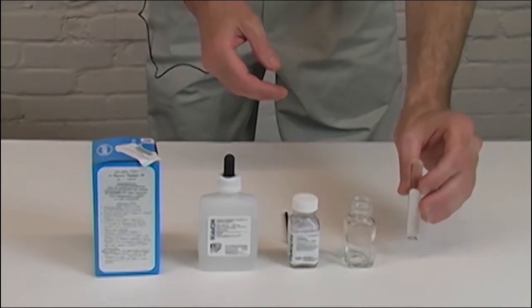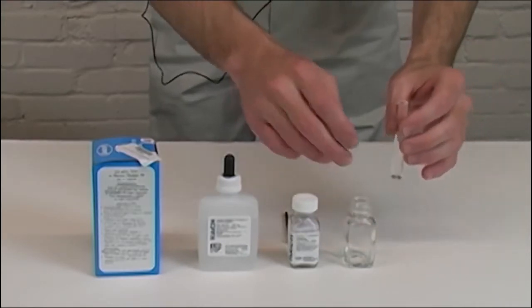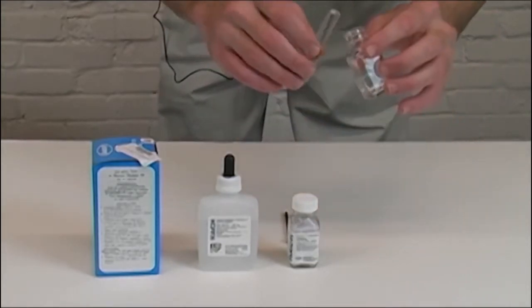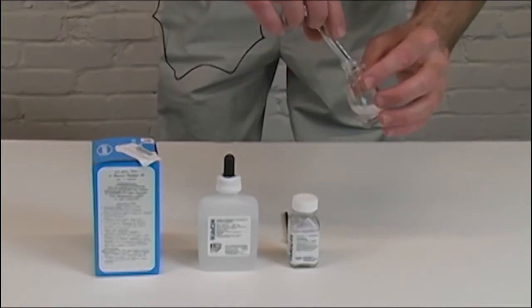Basically what you want to do is collect a measured sample of your water and pour it into the mixing vial.